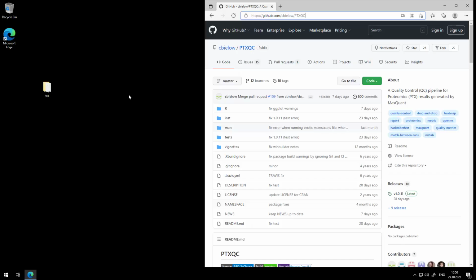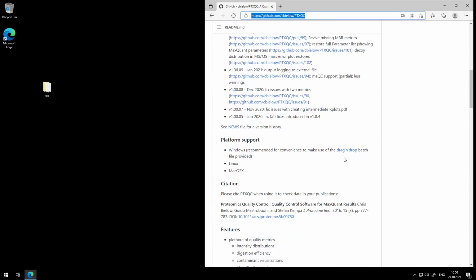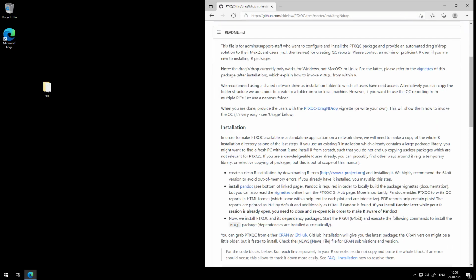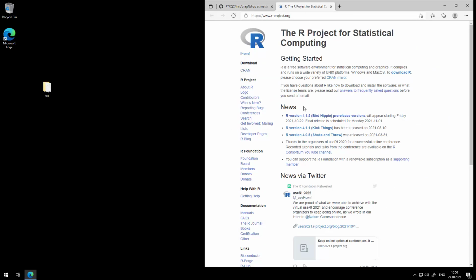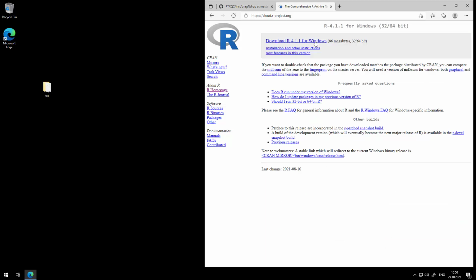So let's have a look at how to install PTXQC. I pulled up our main web page. Let's look at drag and drop installation. There's a vignette for this. We're just going to first download R. This is a vanilla virtual machine, it doesn't have anything, so let's just download R. You can skip this step in case you already installed a recent version of R. Just make sure it is a 64-bit version.